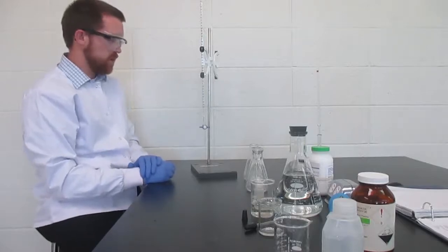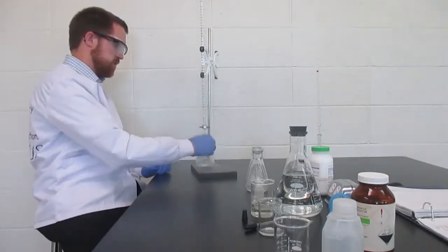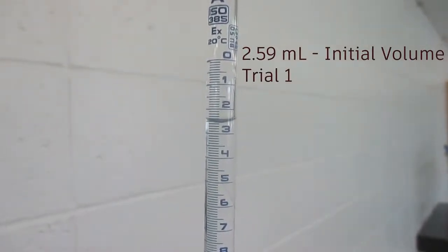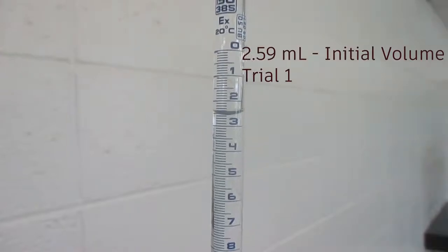Now I have close to 50 mils in here, but we are ready to titrate. I can put one of my samples underneath there. A quick note here about reading your burette. Burettes are graduated from the top down. You'll notice the top mark is zero, and it increases on the way down. So be careful when you're reading them. You can see we're at about 2.5 here. The bottom of the meniscus is about 2.6, and we should be able to estimate one decimal place in between our graduations. Since it is directly on that line or maybe slightly above, I'm going to say 2.59 is what I estimate the volume that we have in the burette right now.